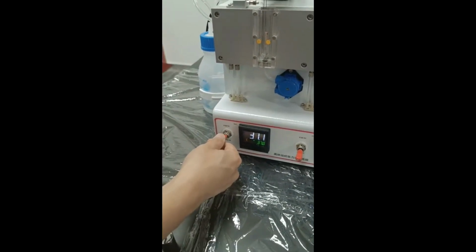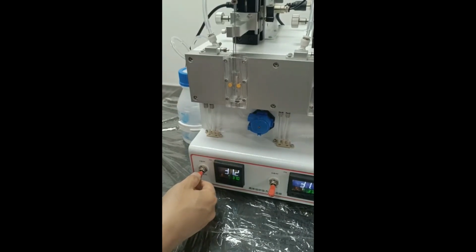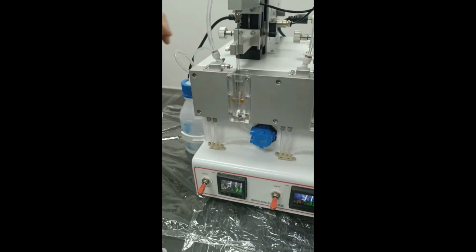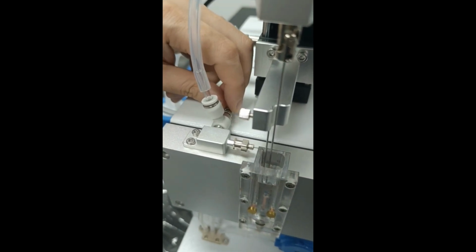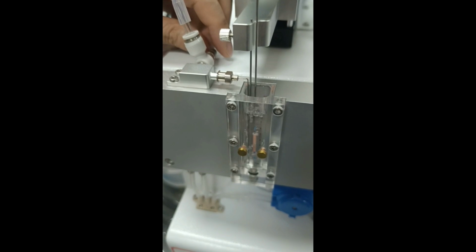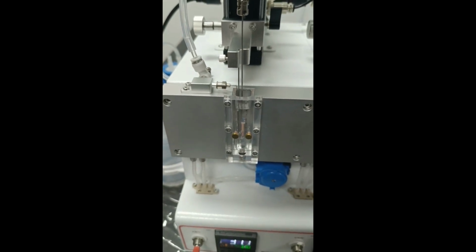Flip the switch to refill the bath. If you need to inject air, you can turn the knob of the air pump to open it. You can see that air has been injected into the bath, and the flow rate of air injection can be adjusted by turning the knob. At this point, our experimental preparation phase is over.